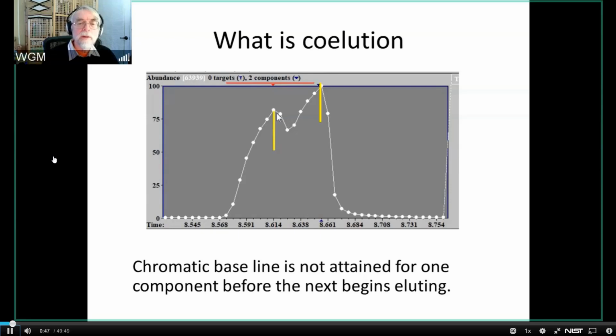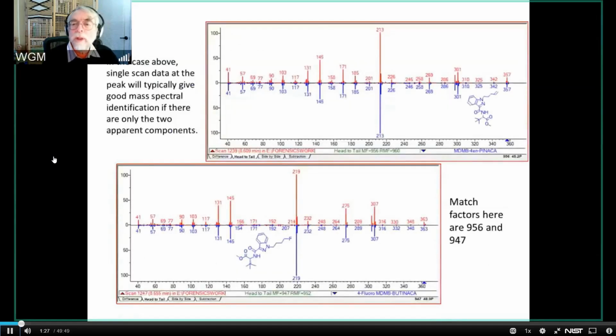So typically that looks, or one of the many ways it looks, is something like this. You've got what looks like the peak, starts back down, and before it gets all the way back to the baseline, it starts back up again. Now, at one level, I would have to say that these are not very hard problems to solve. And the reason I say that is because if I want to understand what these two components are, in general, I can sample that. I can take a mass spectrum at this point, and I can take a mass spectrum at this point. And what I get is, in many, if not most cases, extremely good identification.